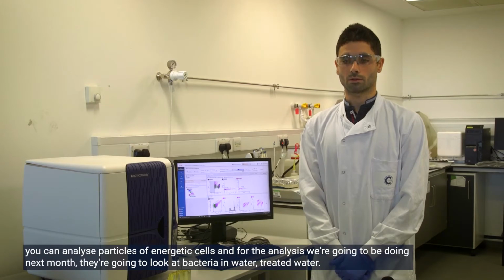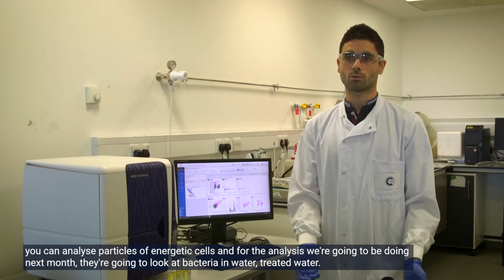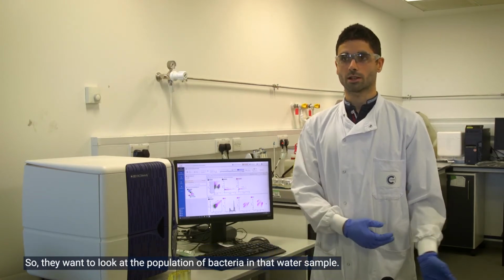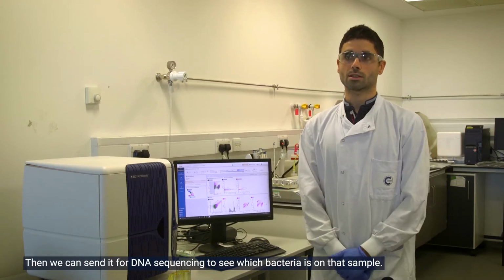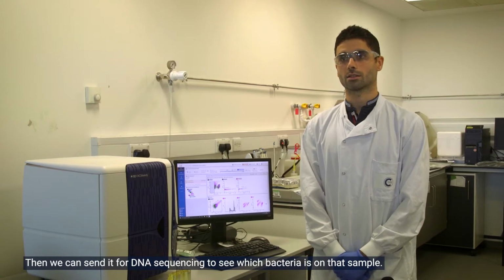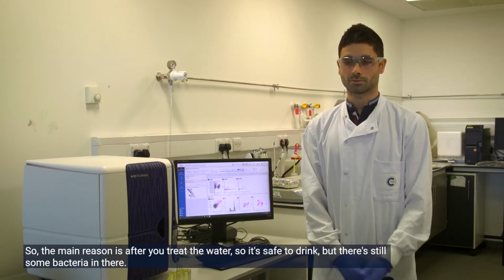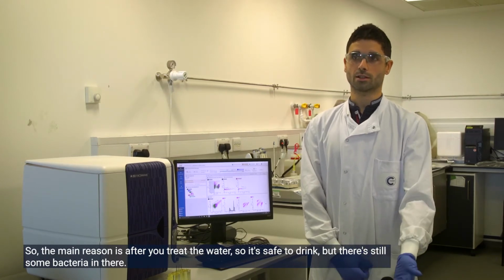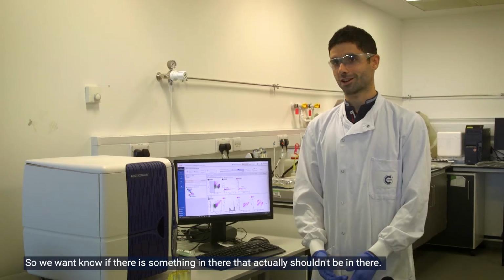And for the analysis we're going to be doing next month, they're going to look at bacteria in treated water. So they want to look at the populations of bacteria in that water sample, and then we can send it for DNA sequencing to see which bacteria are in that sample. The main reason is that after you treat the water, it's safe to drink, but there's still some bacteria in there. So we want to look if there is something in there that actually shouldn't be in there.